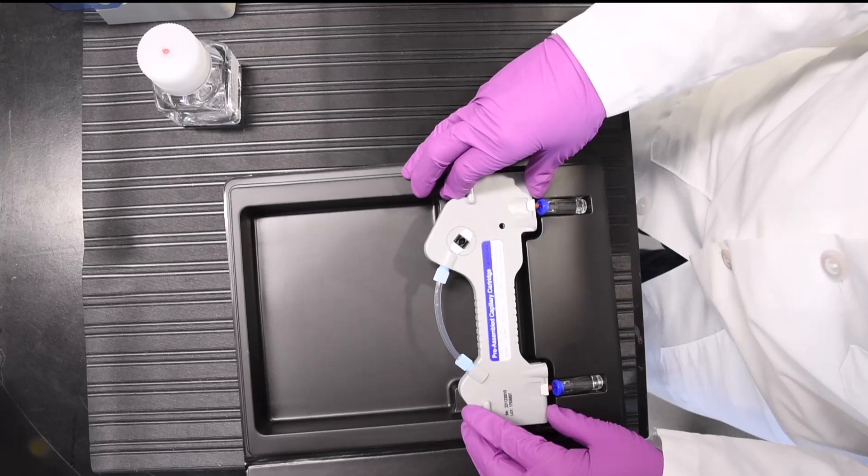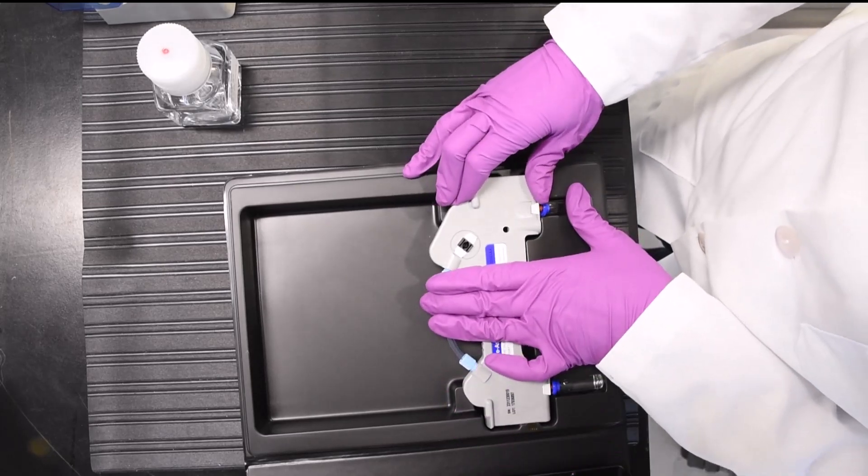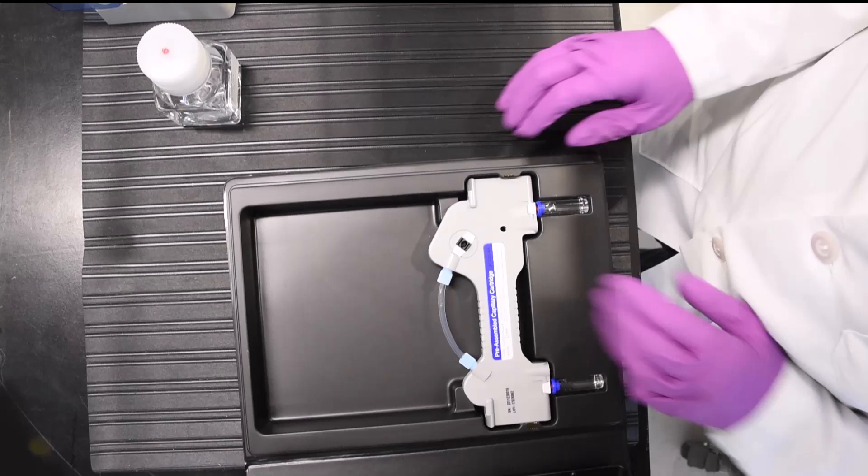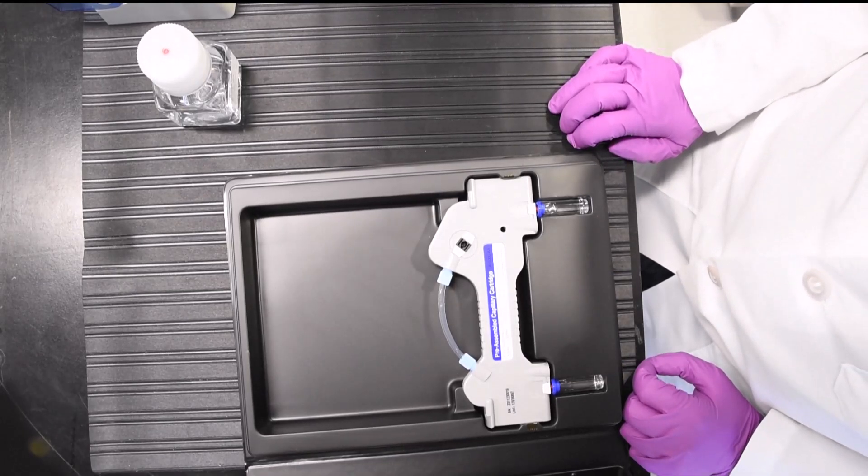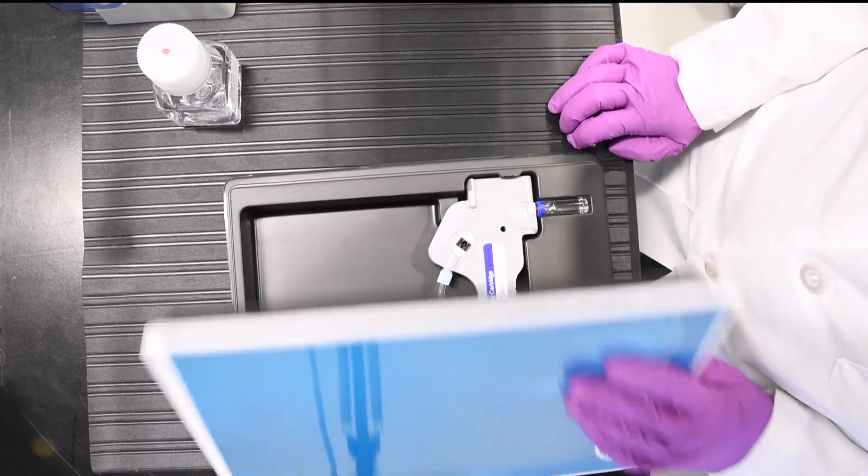Ensure that both ends of the capillary are properly inserted into the vials, fully submerged under the water. Once the capillary is in place, close the cassette securely.